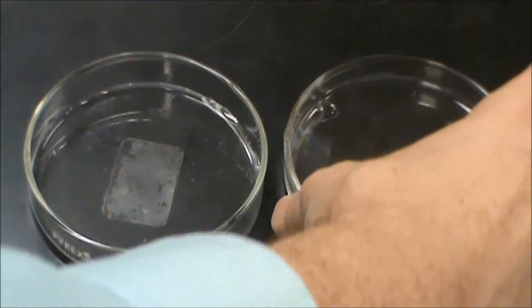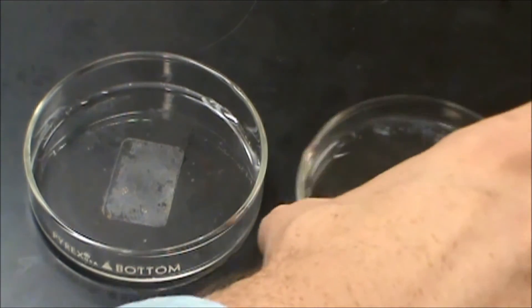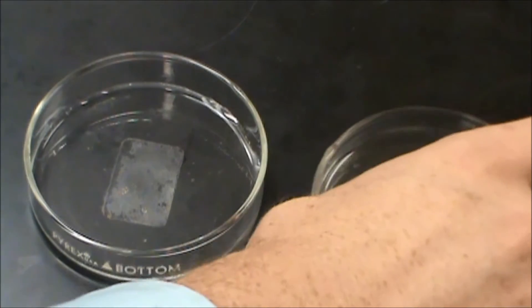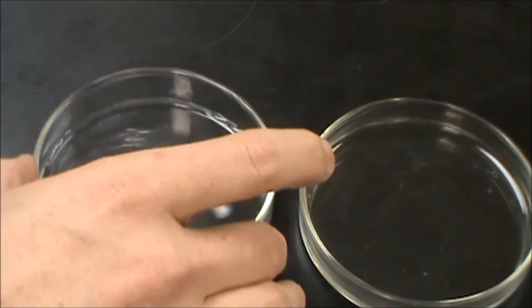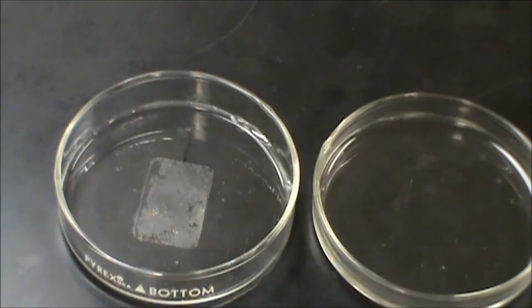And just like before, I'm going to give that a swirl. And you can see that my zinc hydroxide is now gone for both. I've reacted it to form something new by doing an acid-base reaction as well as doing a base-acid reaction.